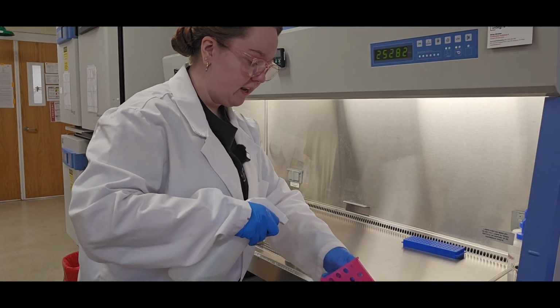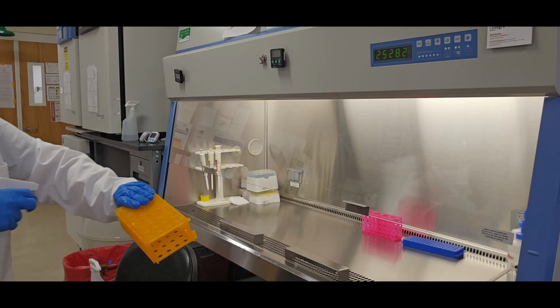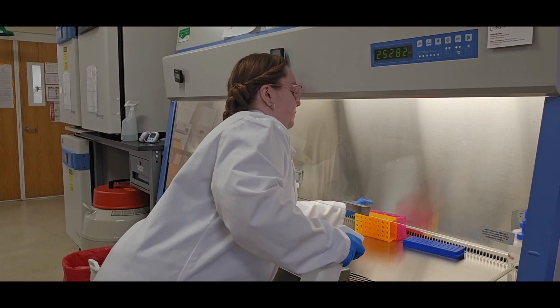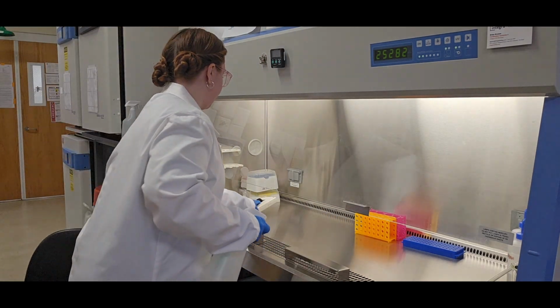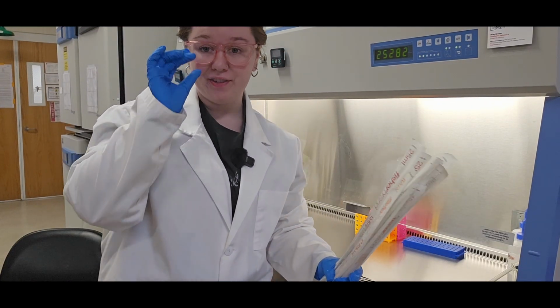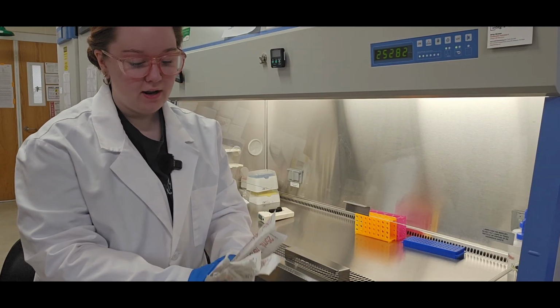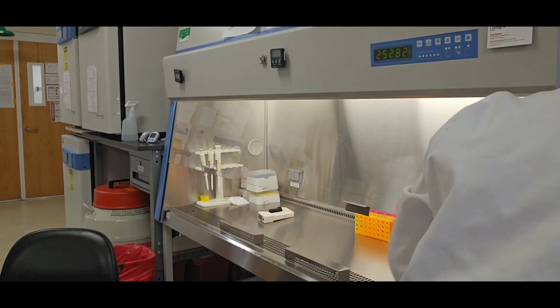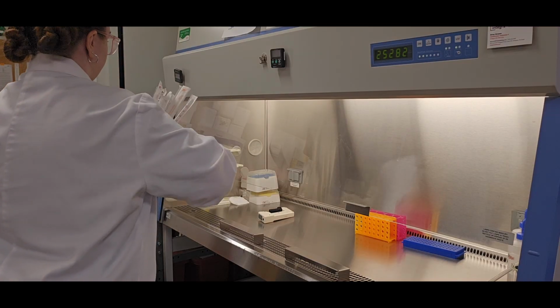I'm adding the tube racks that I would need to hold my trypsin and a 50 milliliter conical tube. There's another tube rack in there to hold a microtube because I thought that I might also do cell counting in this video, but I think I'm going to make a separate video on that. I'm adding my pipette aid that was charging on the bench top. And I'm also adding serological pipettes in 5 milliliter, 10, and 25. I'm grabbing multiple in case something happens with the pipette and I need to get a new one. And then spraying those with ethanol and adding it to the biological safety cabinet.